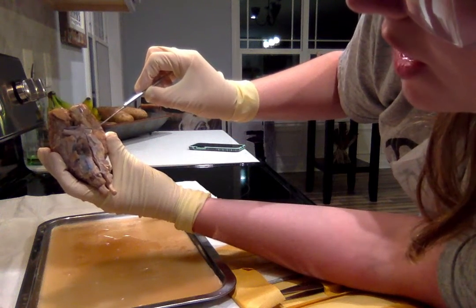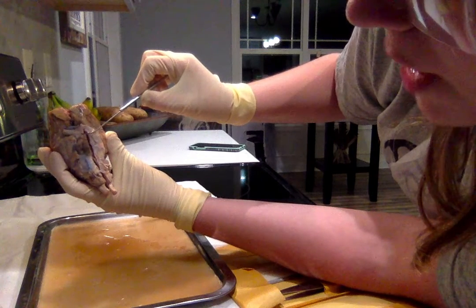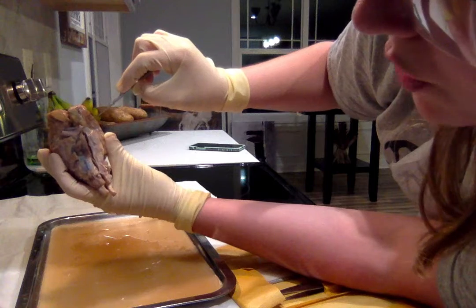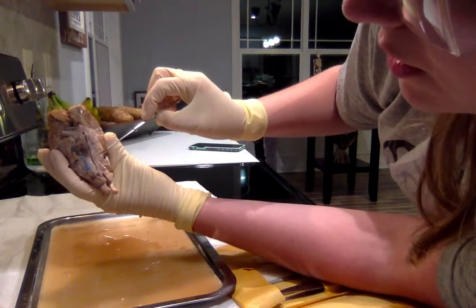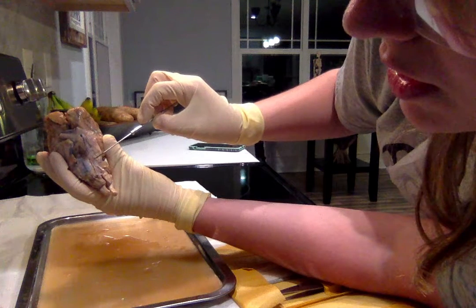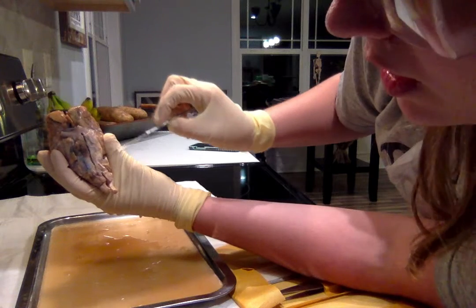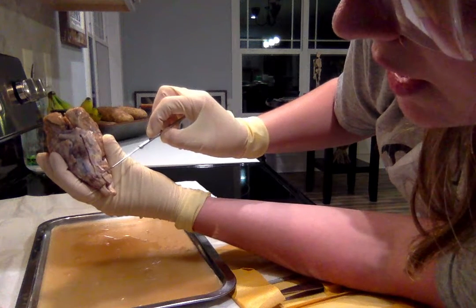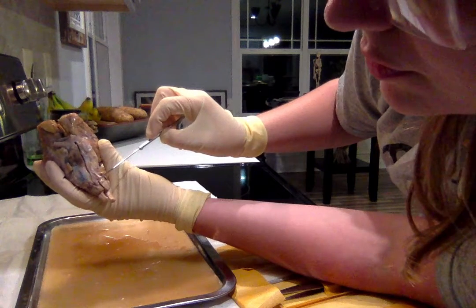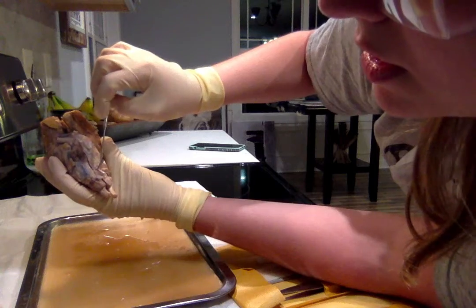This part right here is your optic nerve, and right here in the middle of this white piece is the optic tract. If we go down, right here is the oculomotor nerve. And then right here in the middle where this white piece is, that is the trochlear nerve. This piece right here in the middle is our pons.